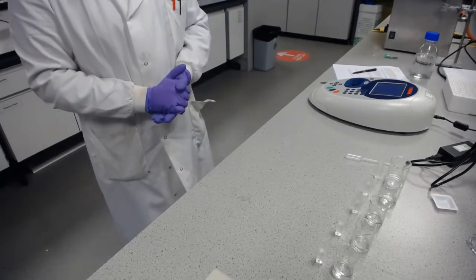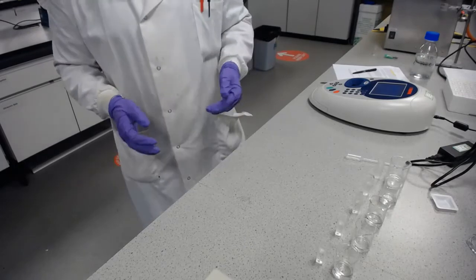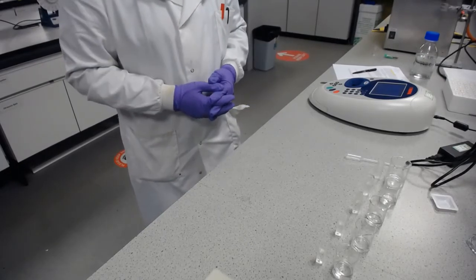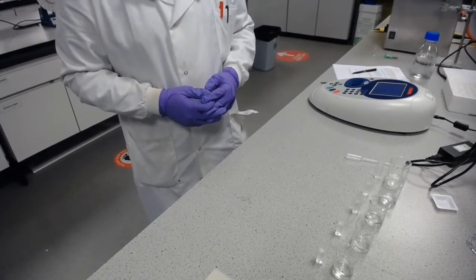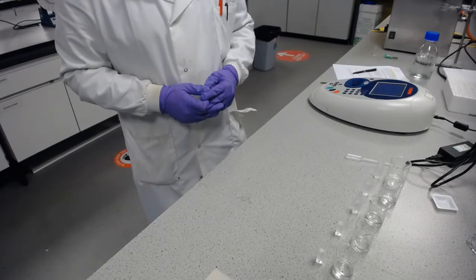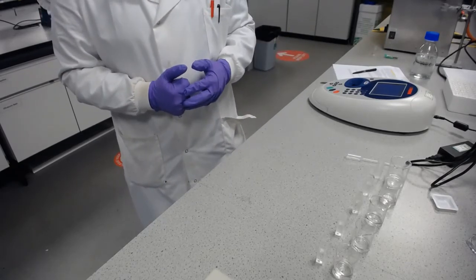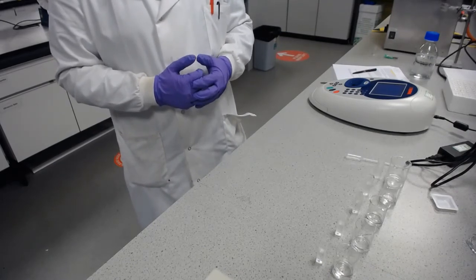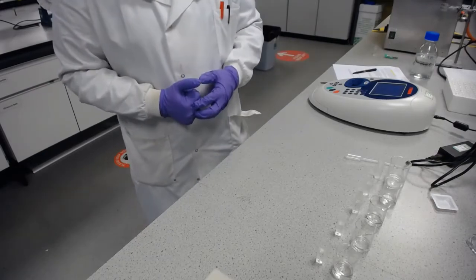Okay, so there we have those. I've noted down the measurements and I'll share those with you so you can use those as well to work through this properly. But I'll be taking a few more averages to just get you the best results possible for that. So now the two liquids are separated in the fume hood, and we'll be going over there again to tap off the two different phases and dilute the one phase so we can get a reading for the absorbance.